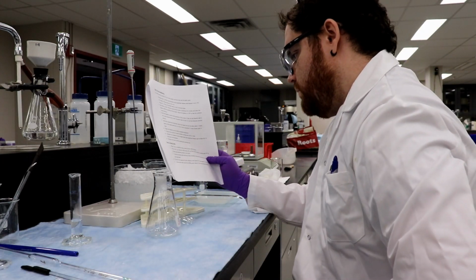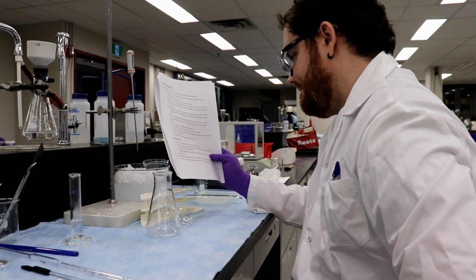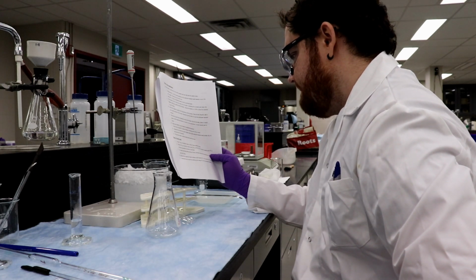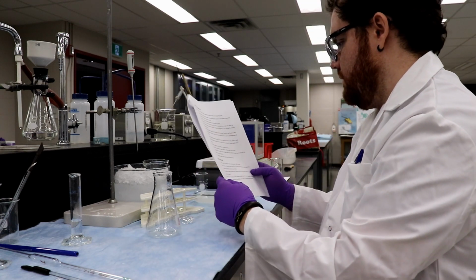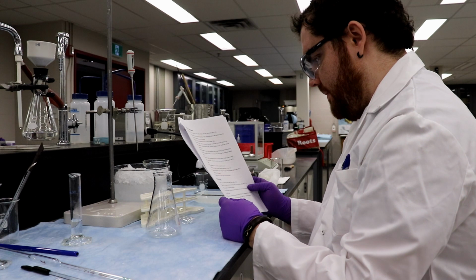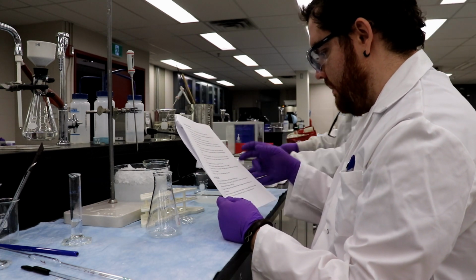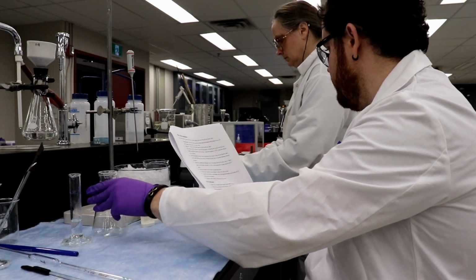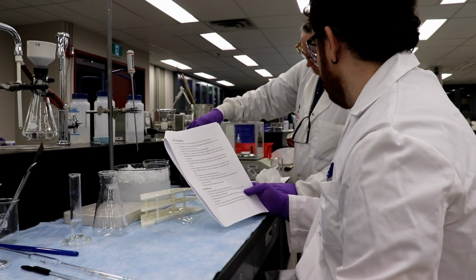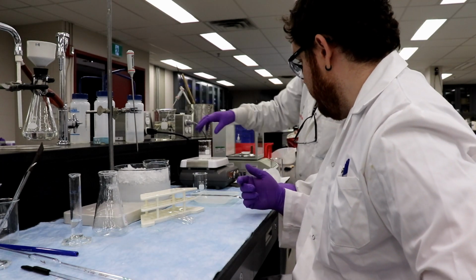So we have to have the crystals dissolved, and you're going to put a watch glass on the beaker. And you're going to put it on the black bench. Yep, and then once the crystals dissolve, remove the beaker from the hot plate, place a watch glass on the beaker, and allow it to cool to room temperature. Crystals should start to form. Perfect. So we're basically solubilizing our crystals right now. So we're cranking up the heat, we're going to solubilize our crystals, pull them down.